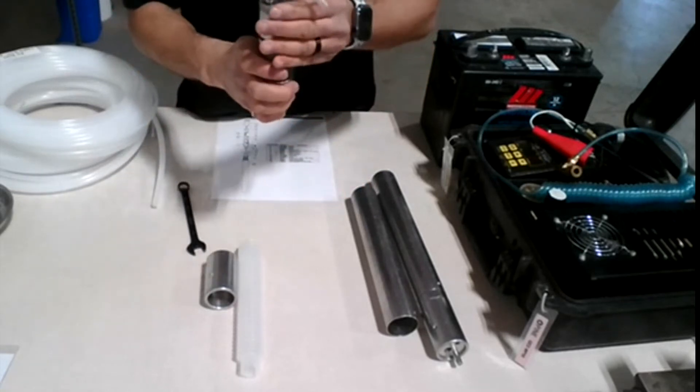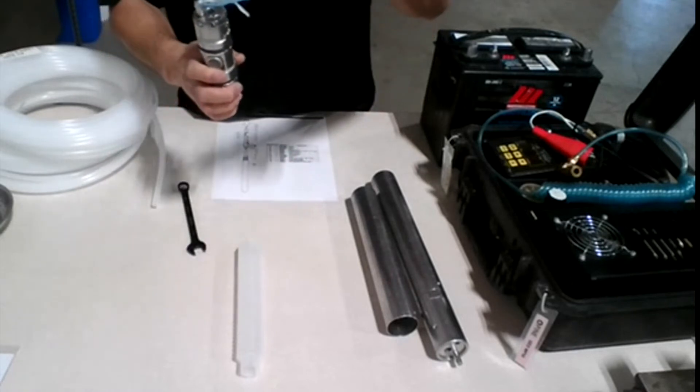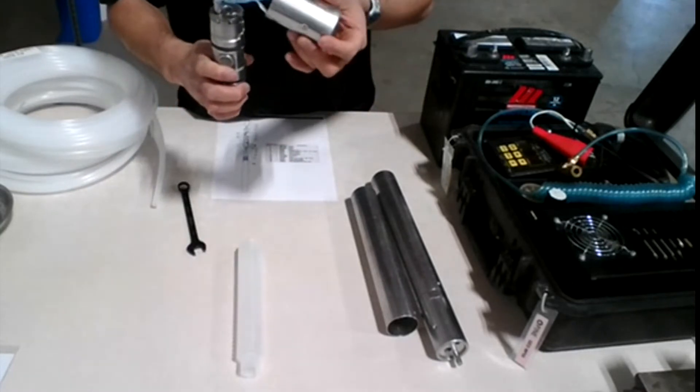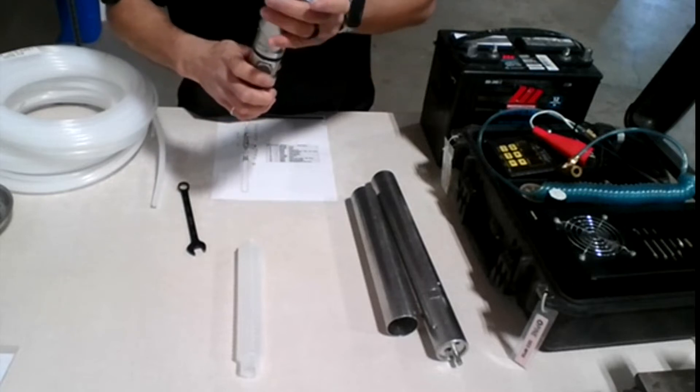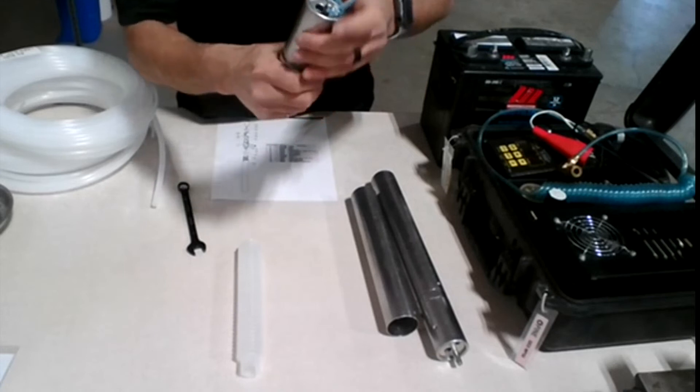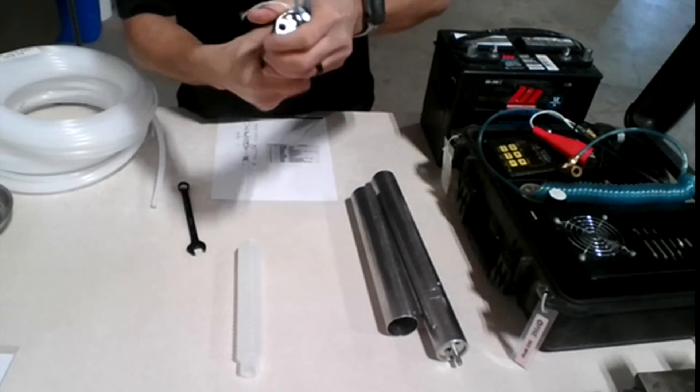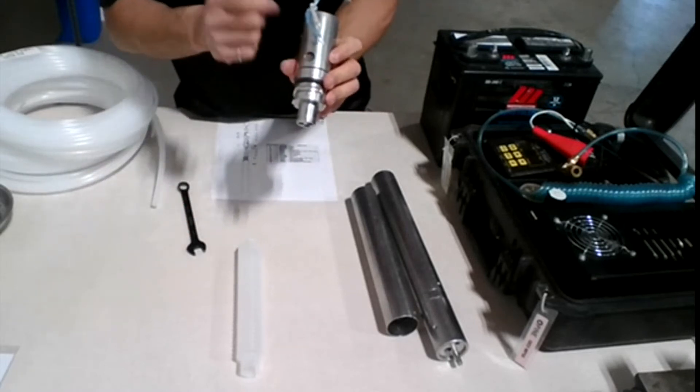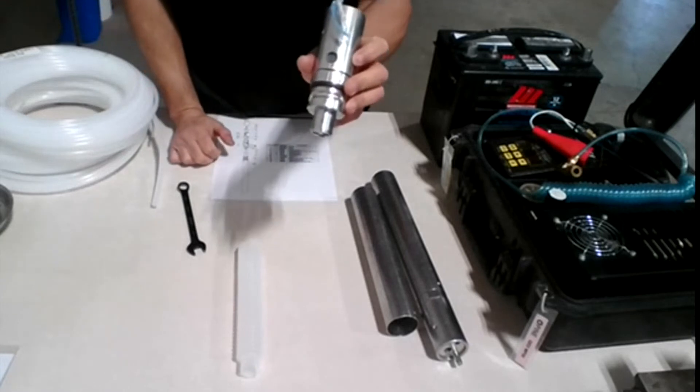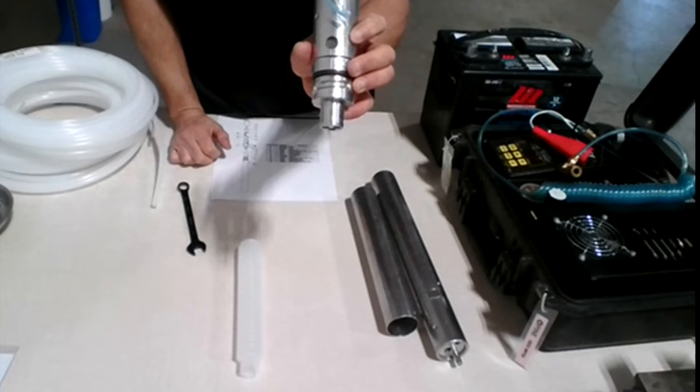And finally, we're just going to slide the head cover on top of it, just to make sure everything stays in place. Just making sure that the head is actually lining up with the inlet port here, so you can actually see the screen from the outside.